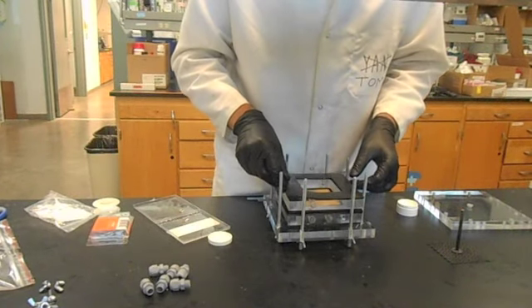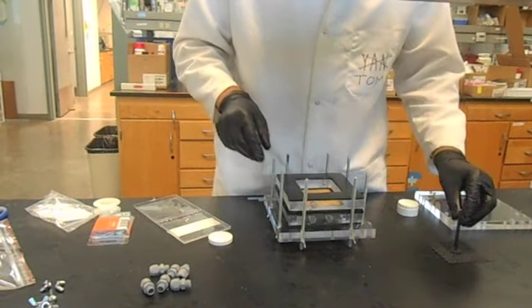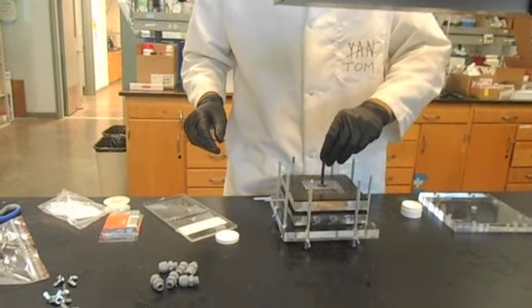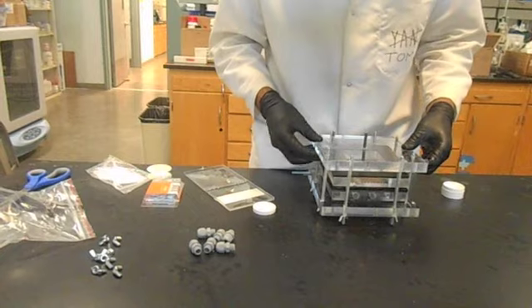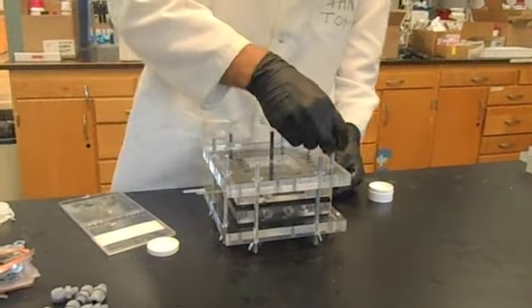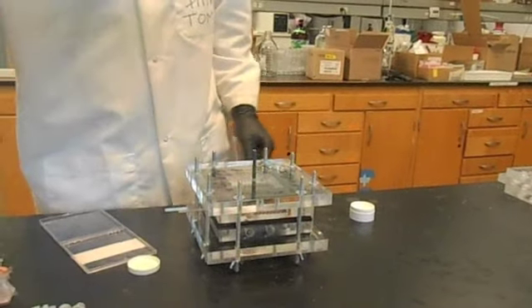Place another rubber on top of the interior cell and fit the anode into the half cell compartment so it sits slightly above the membrane. Shimmy the anode exterior frame over the threaded rods in the anode and press it gently against the interior half cell. Place the washers and wing nuts over the threaded rods and loosely tighten all of the wing nuts.